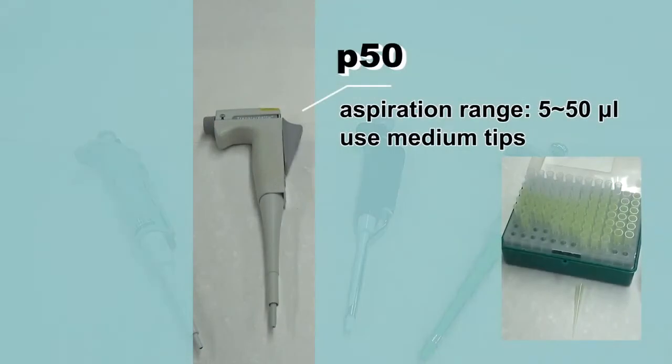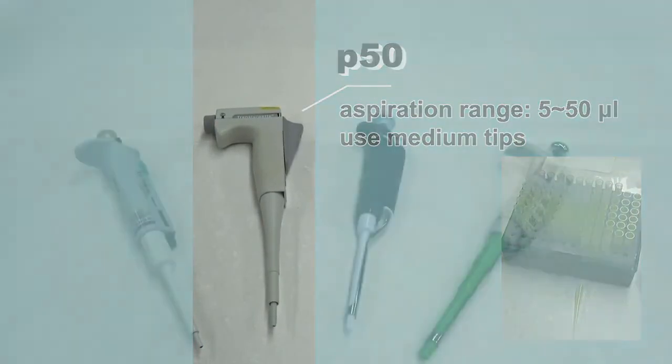The P50, which has an aspiration range of 5 to 50 microliter and uses medium tips.